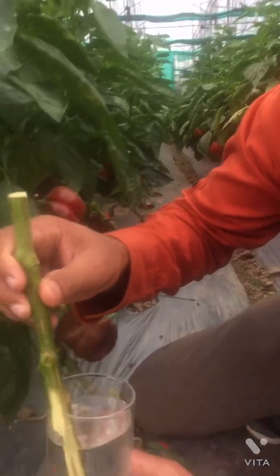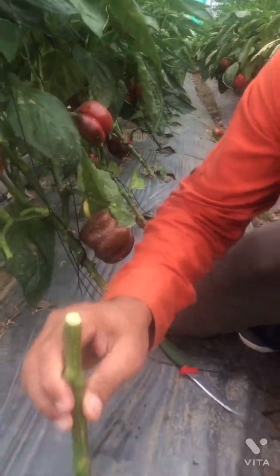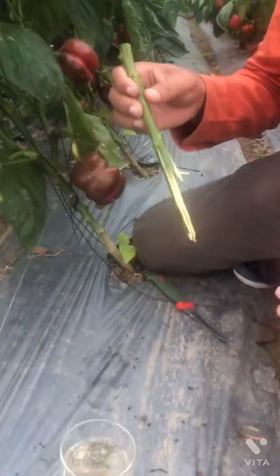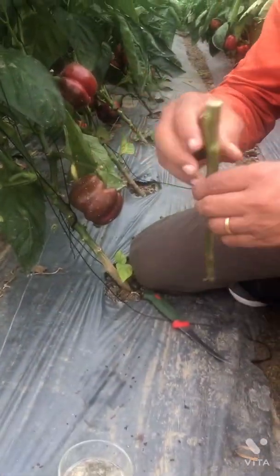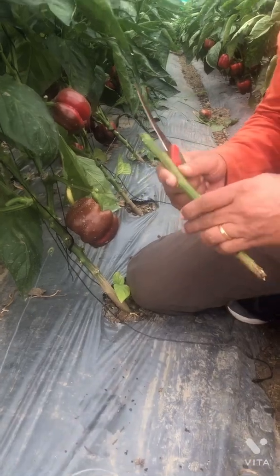If it is positive, there should be a gum-like ooze coming out. Let me cut a little bit more and leave it for some time to observe.